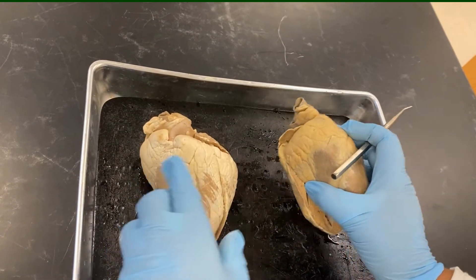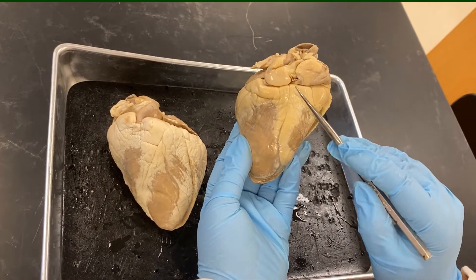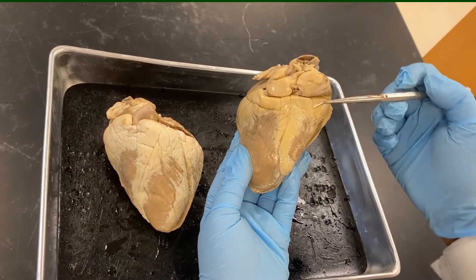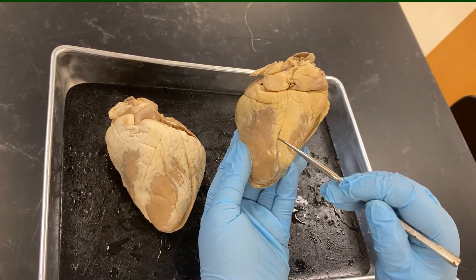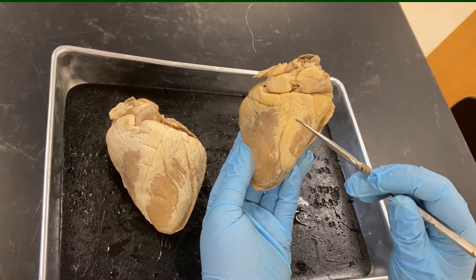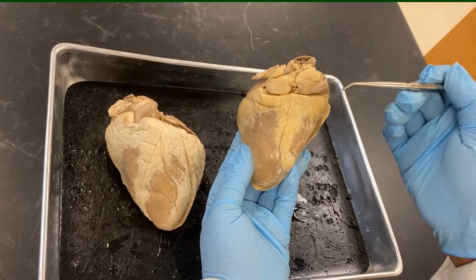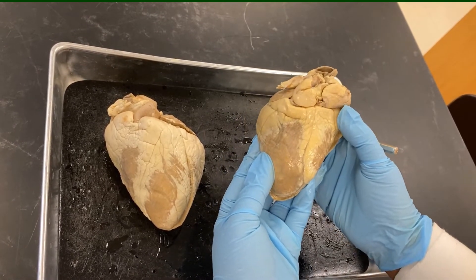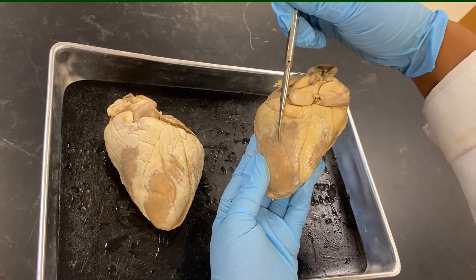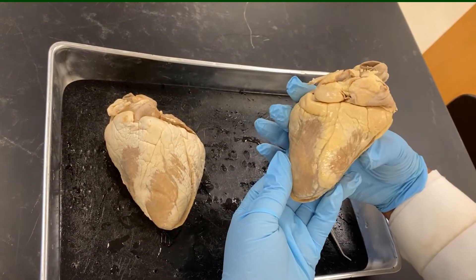When we look at the posterior view, you will see there is also a separating landmark between the ventricles, but this line is almost straight. That's the interventricular sulcus, and the branches of the coronary circulation pass through this area — those are the posterior interventricular blood vessels. So the sides will be: this is the left ventricle, this is the right ventricle. This orientation is important.